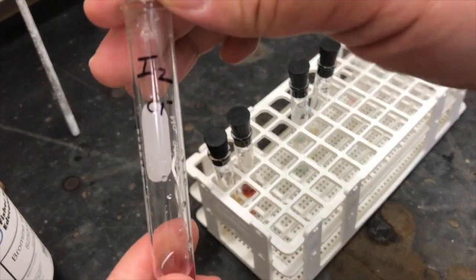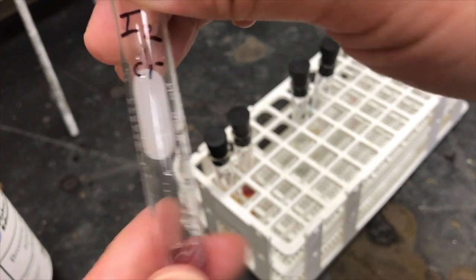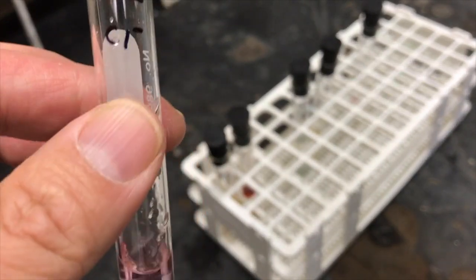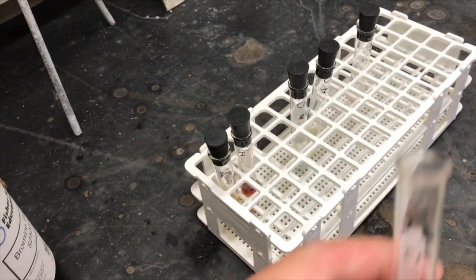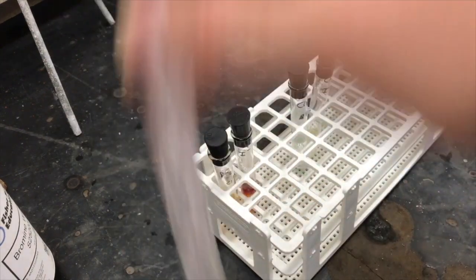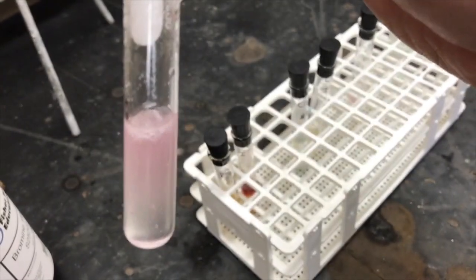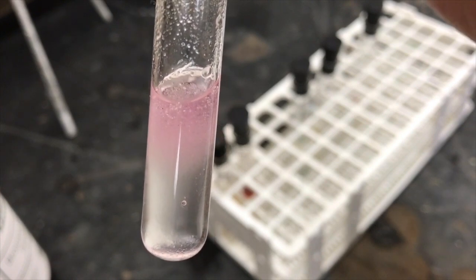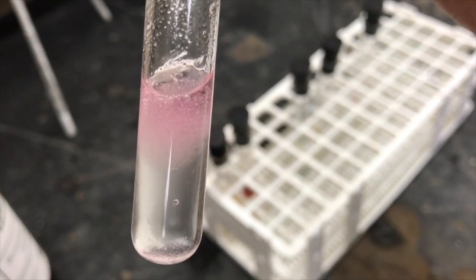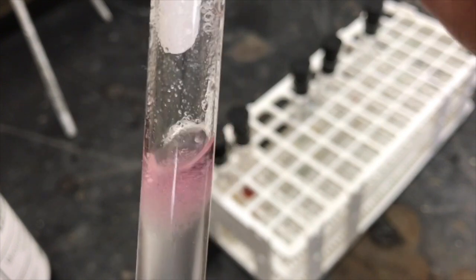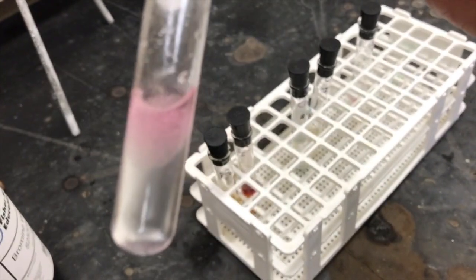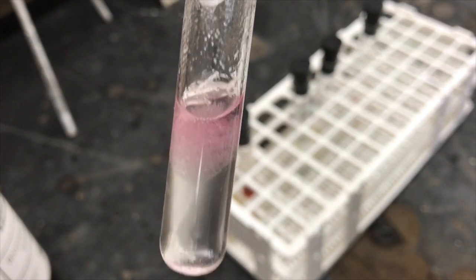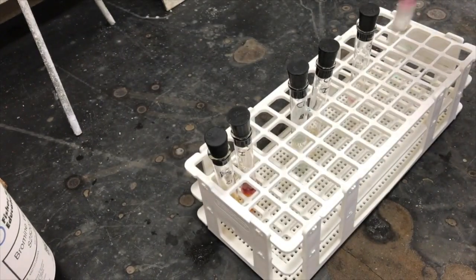The last tube I'm going to test is the iodine and I'm going to add chloride to it. And essentially there is no change. The top is still nonpolar and it's still pink the bottom is still clear. Now you may notice that I did not do all nine combinations because it's a little redundant to react the bromide with bromine or the chloride with chlorine or the iodide with iodine. Those would not see any change that's why I didn't do those tubes.